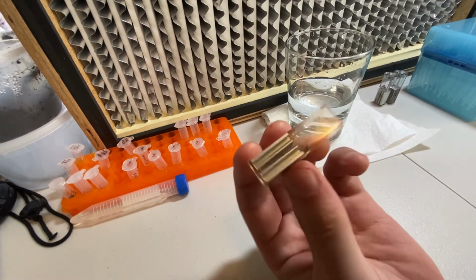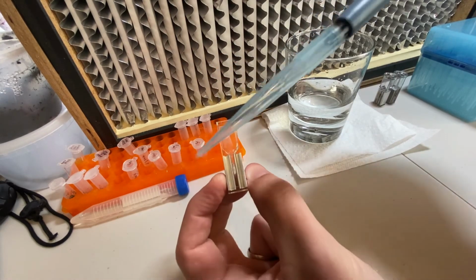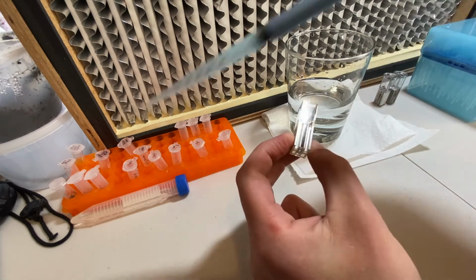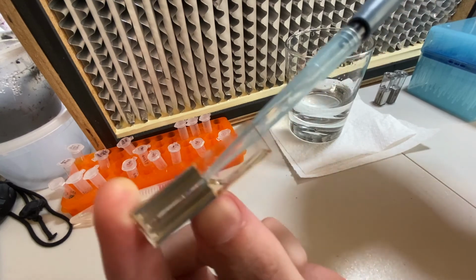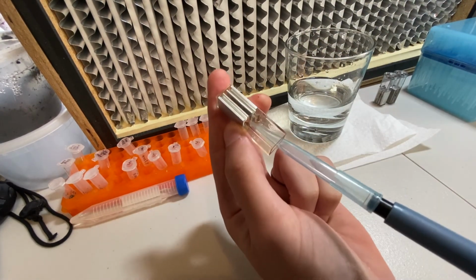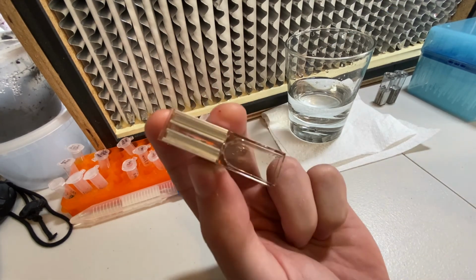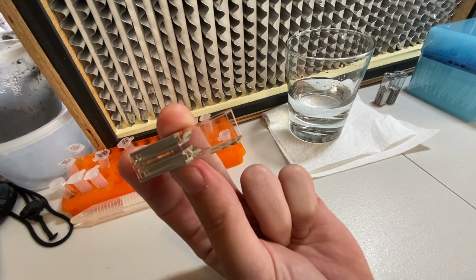Well, I think we have figured out the best approach here, and that is to use a regular full-size pipetter. Putting 1 milliliter of recovery liquid or media in here does work, and we have to tilt it this way to draw out all of the media. And so we'll try using this technique the next time that we run our experiments.